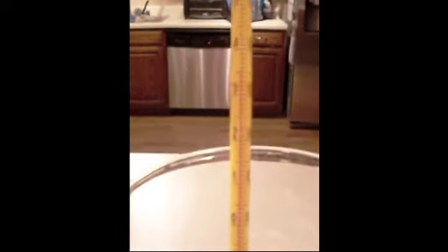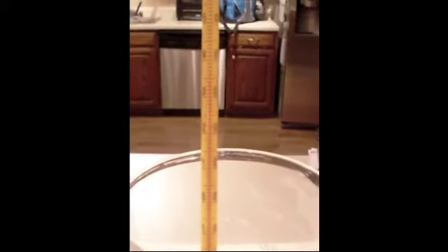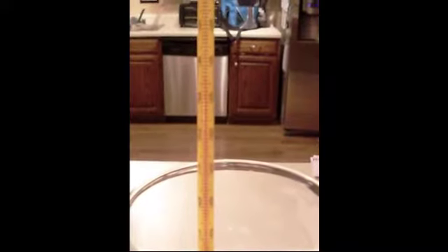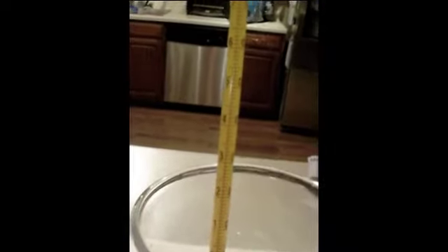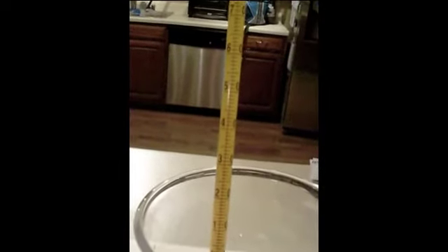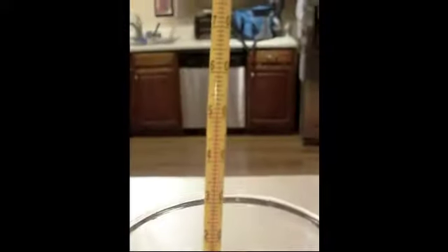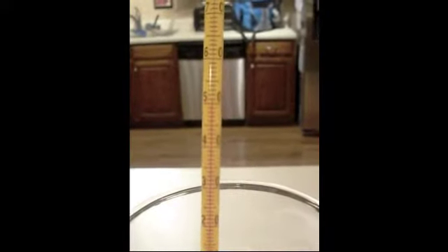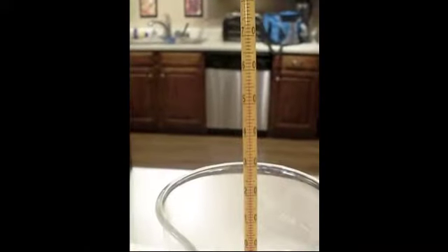Minute 6. It's the water. Minute 7. Minute 8. Just the water. Minute 9.